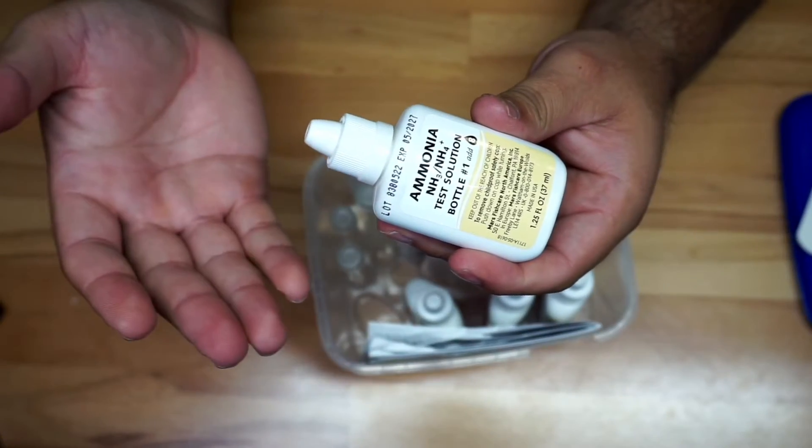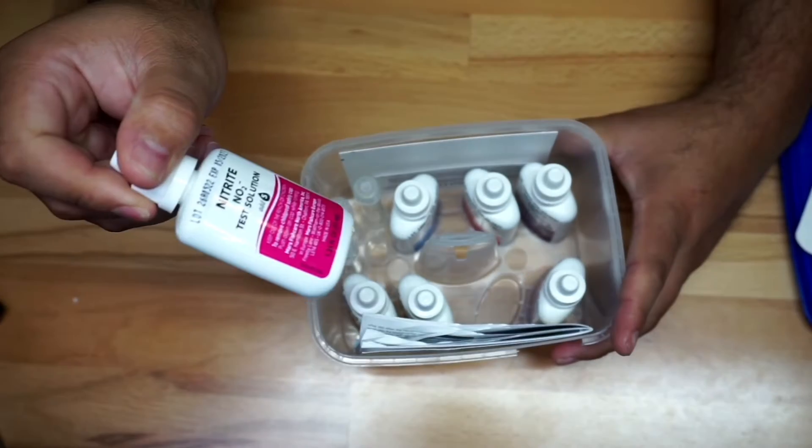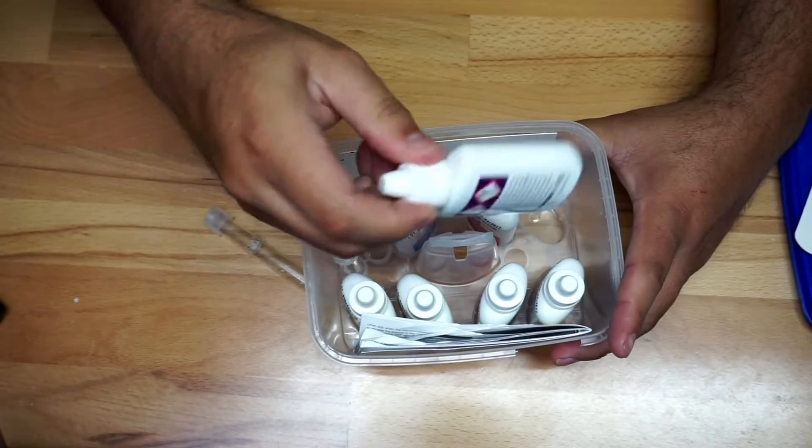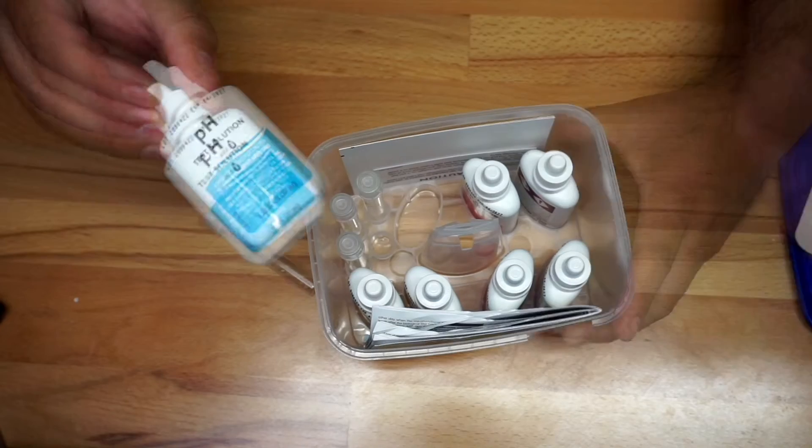In this case we're going to be testing ammonia. Obviously you could test nitrate as well. More testing right here and this is primarily the things that you actually need to test. And I believe pH as well.